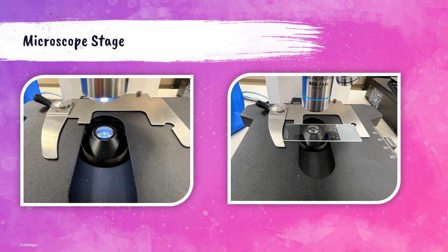This shows the microscope stage. The photo on the left-hand side shows the stage without a microscope slide on it, and the right photo shows a glass microscope slide that is properly on the microscope stage.